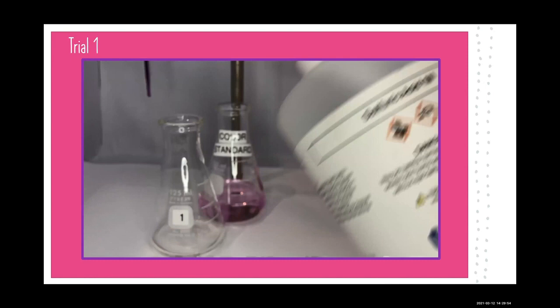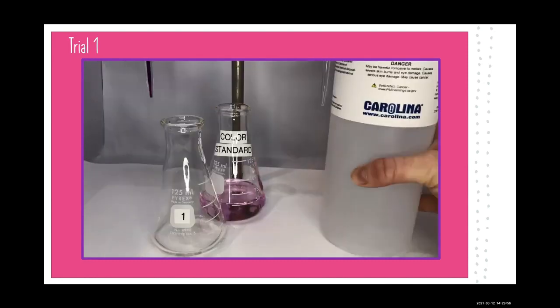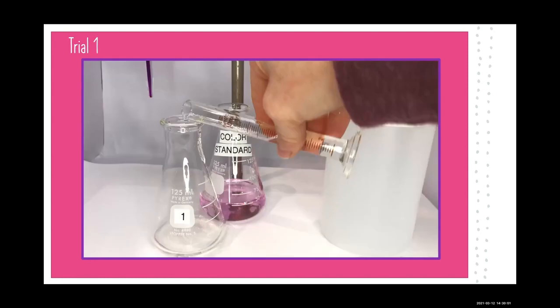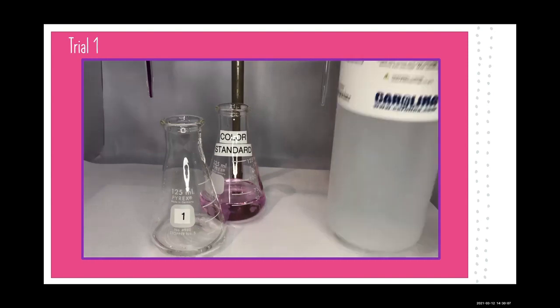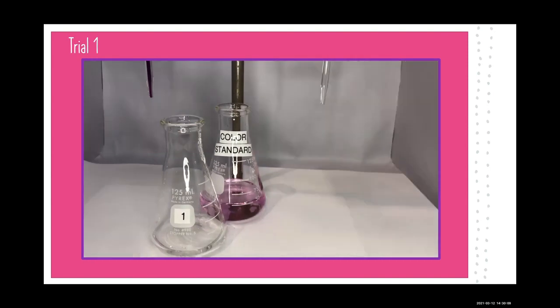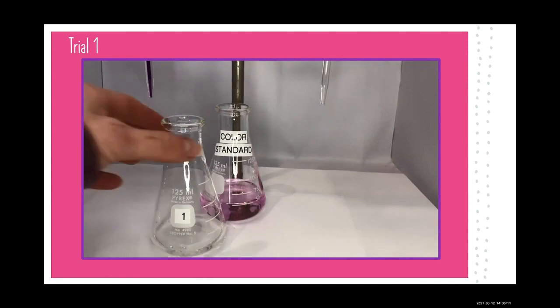And now we're going to add 5 milliliters of our 1 molar sulfuric acid to this flask. And now we're ready to titrate. We're going to keep our color standard nearby so that we know what we're shooting for.